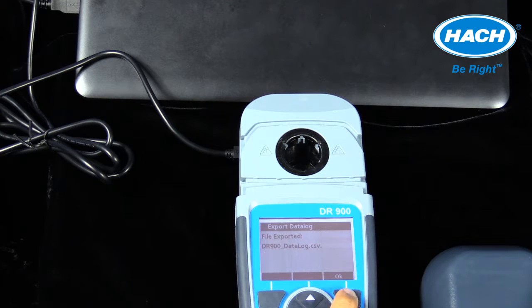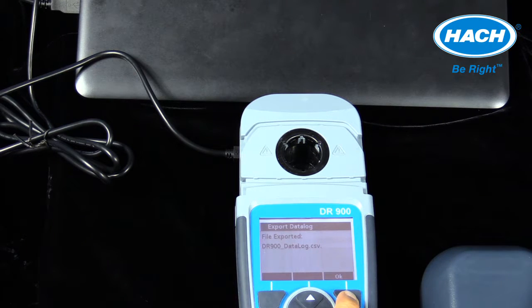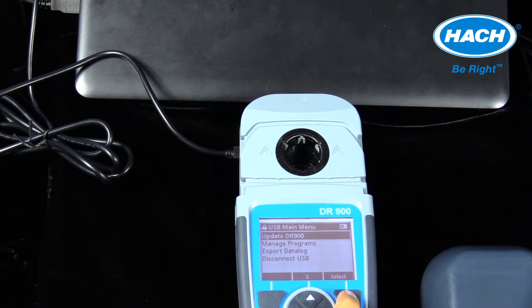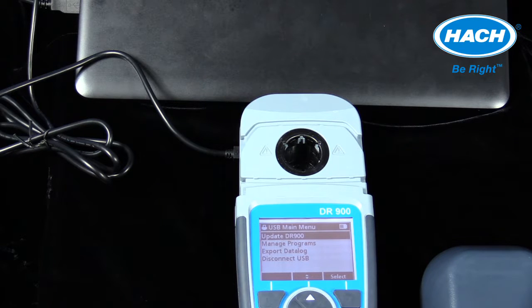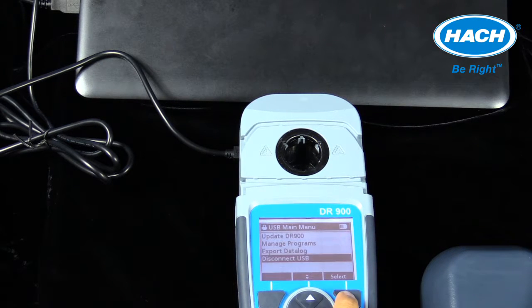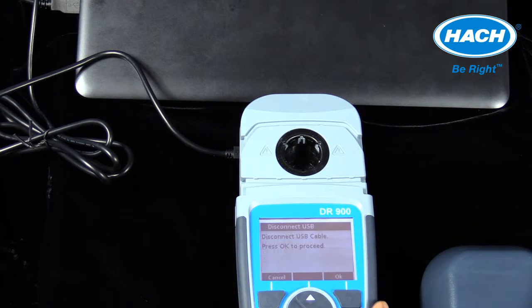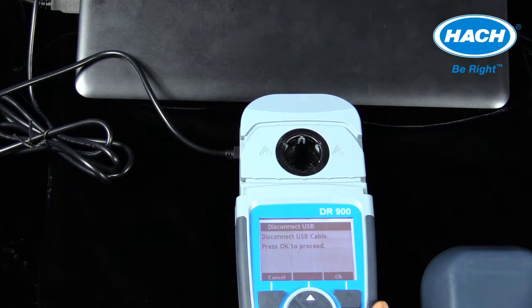When this is done, select OK. After the data log transfer is complete, select disconnect USB from the USB main menu on the DR900.